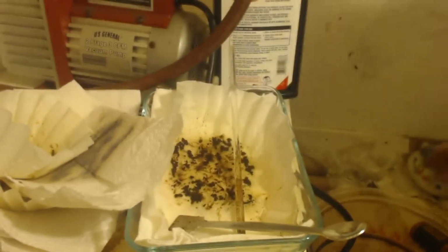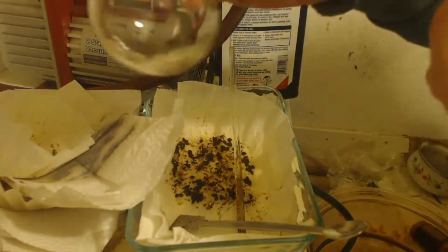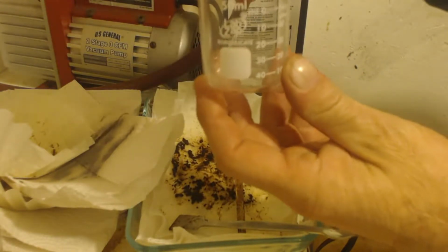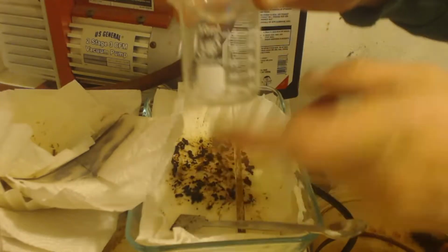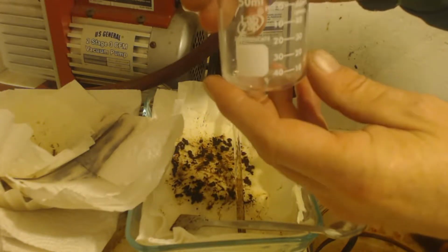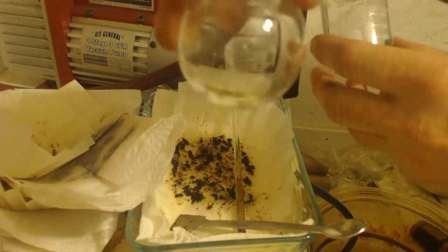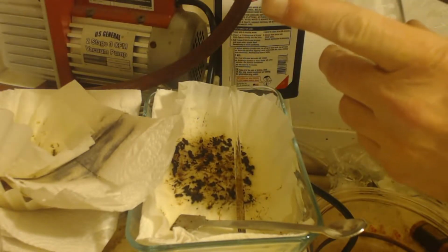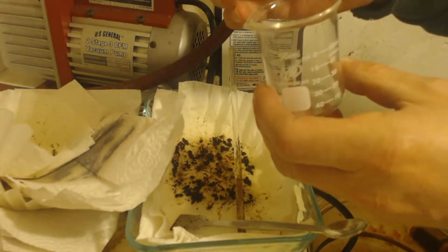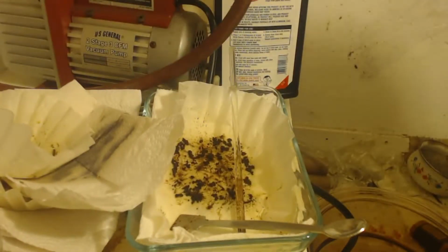What a lot of people do is they'll get the beaker, put the iodine in the beaker, and then get a round bottom flask, fill it up with water, and put it on top like that, see? Then you can heat the iodine down here and distill it. Since iodine sublimes pretty easily, it's nice and easy to distill. It goes up to the cold water that you put in here, and it will condense right here, or solidify. Then you can scrape it off, and you'll have nice, pure, clean iodine. I don't really have that much, so I'm not going to do that.